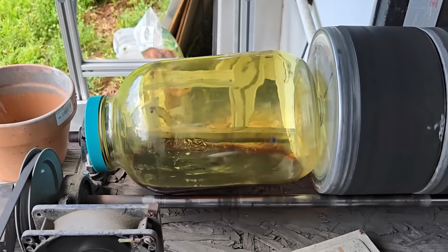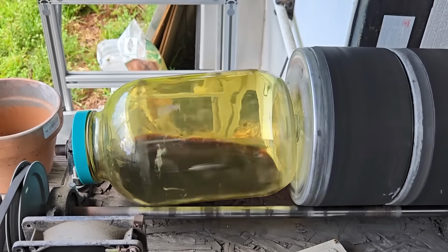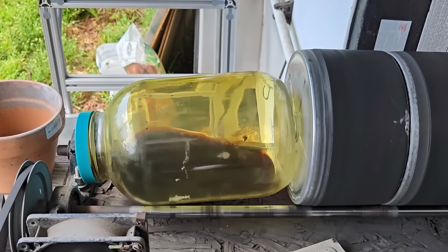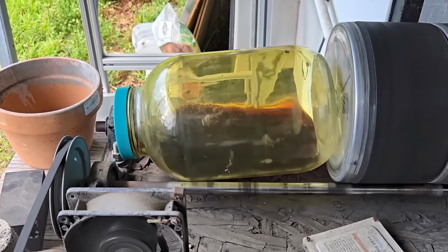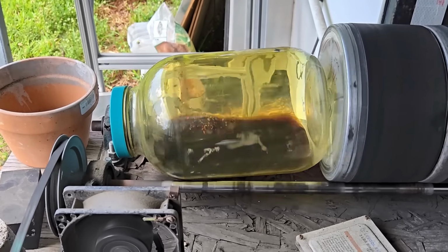And we're going again. We're getting plenty of agitation, and that is something I'm very happy about. So we'll just let this go for another 15 minutes. What's the time right now? It's 2:27, and I probably put this on 2 minutes ago. So we'll say it started at 2:25. I'll take it off at 2:40.